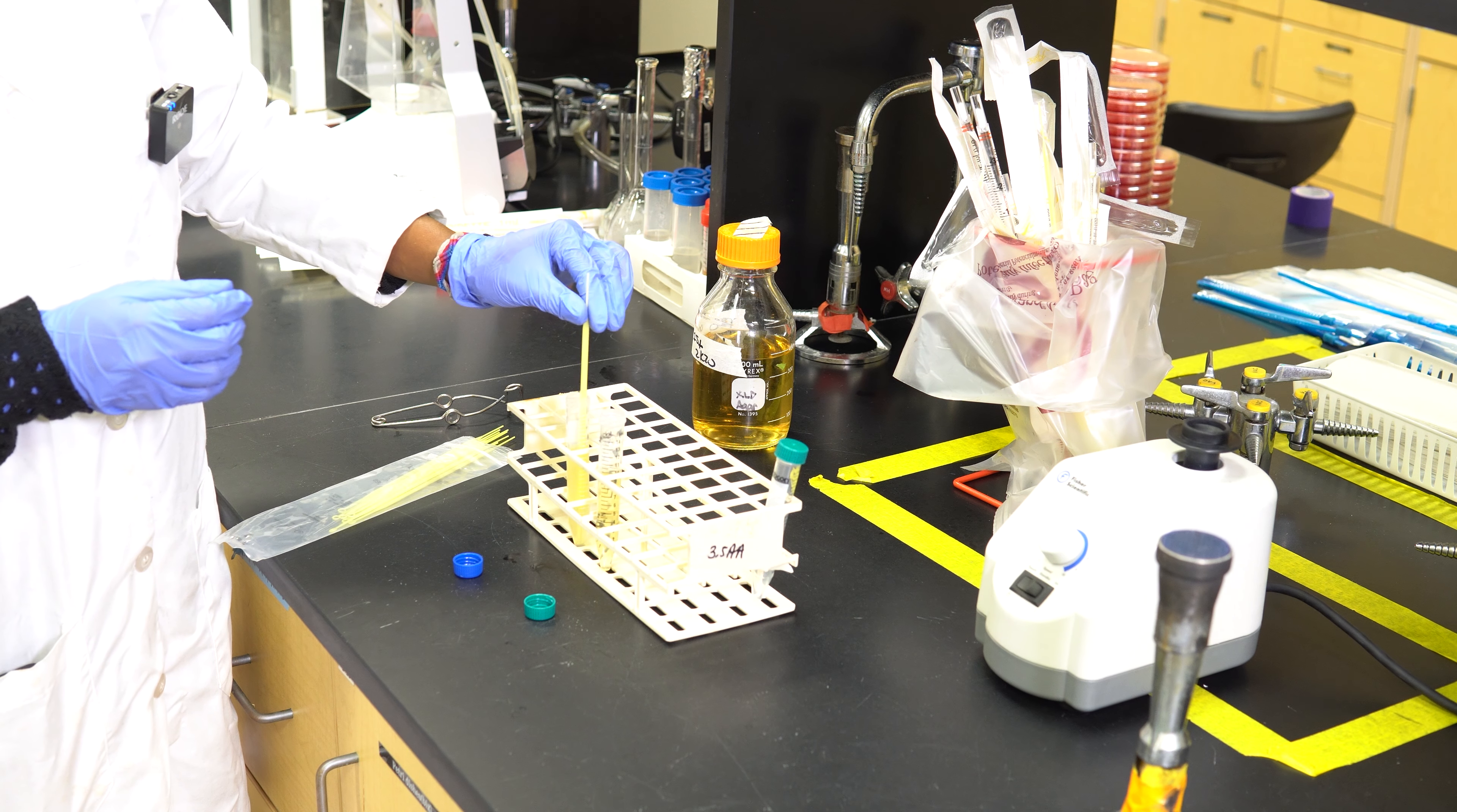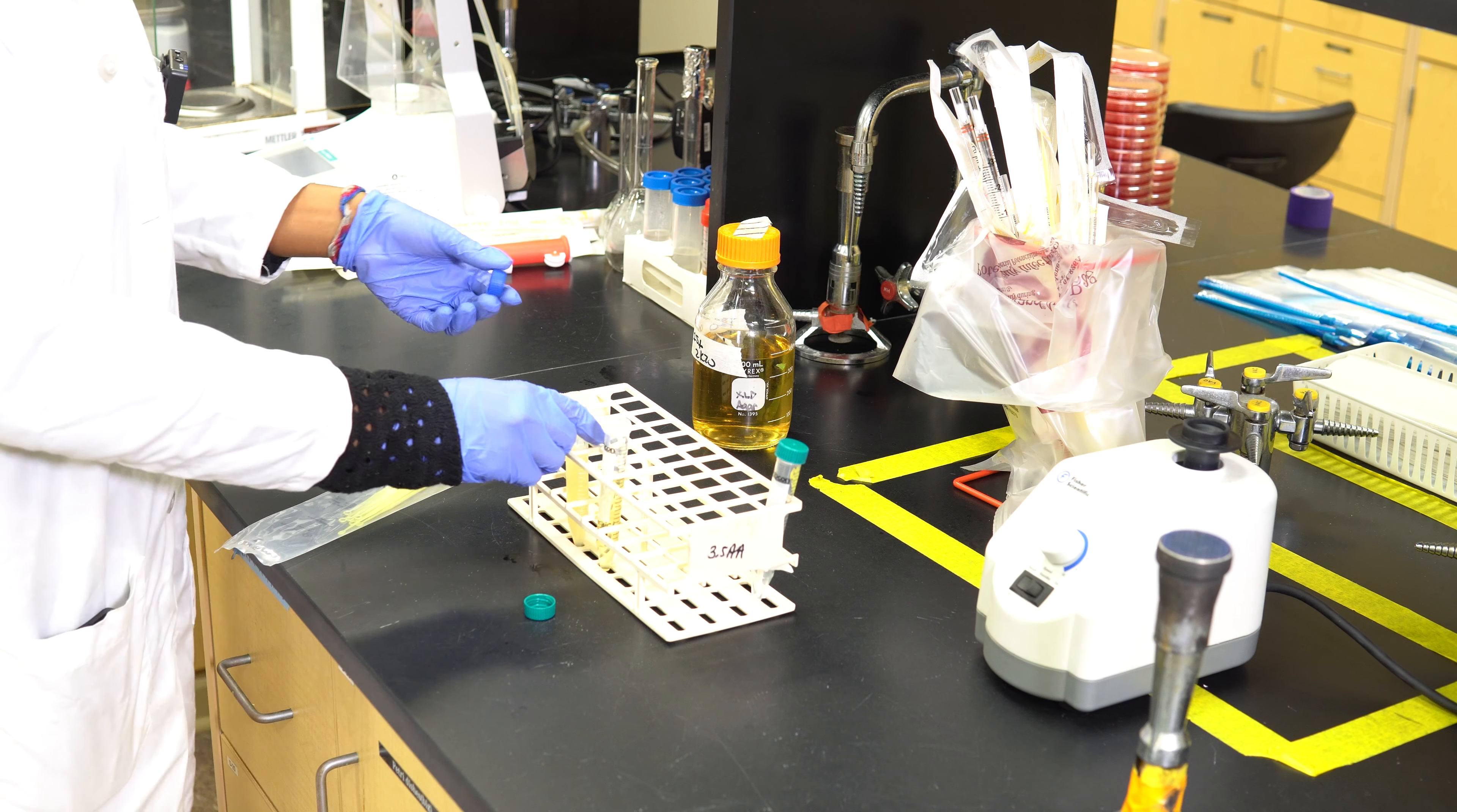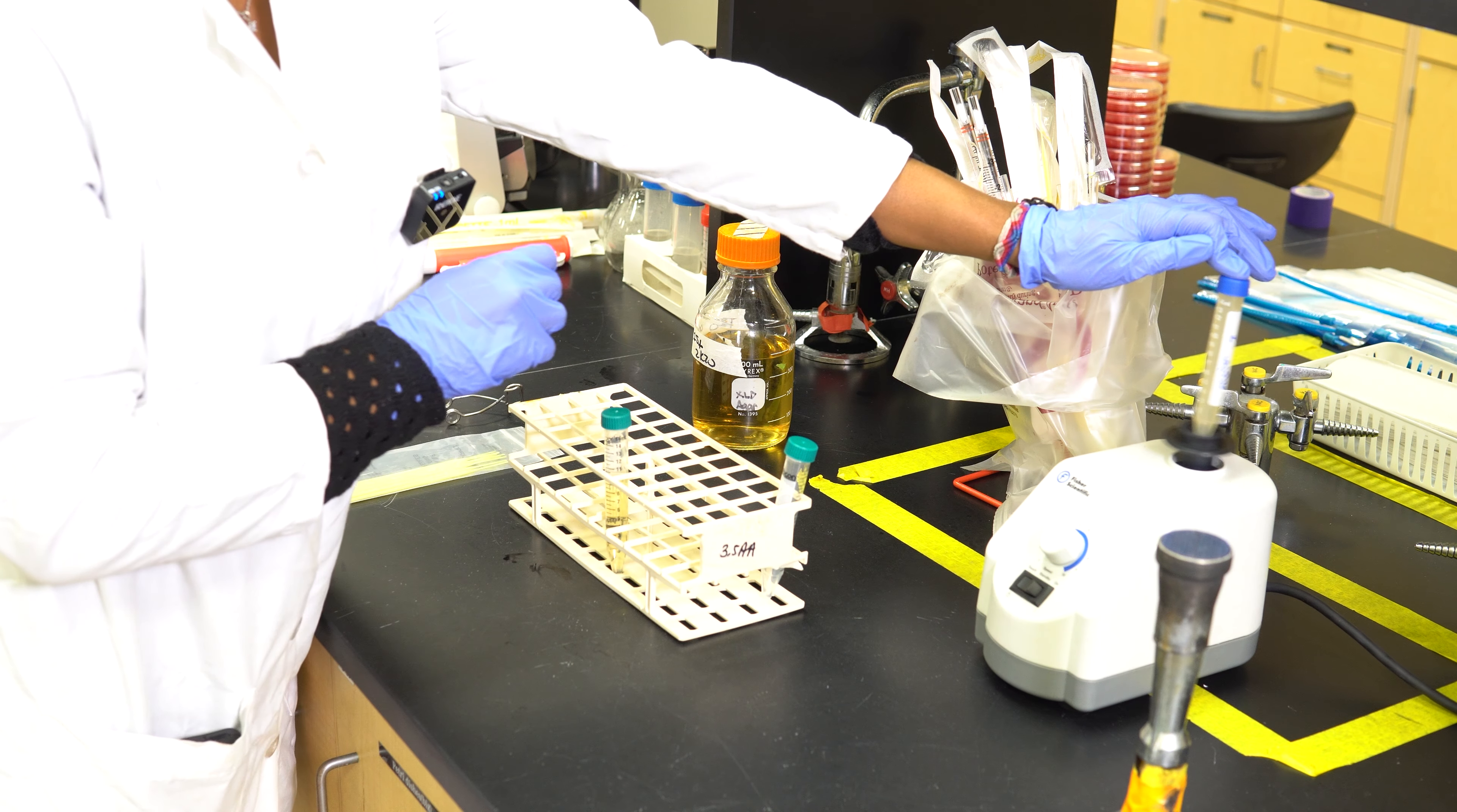Next, you're going to run the neck of the microorganism through the flame, and you're going to also do this with the top. You're going to also do this with the fresh TSB, followed by the top.